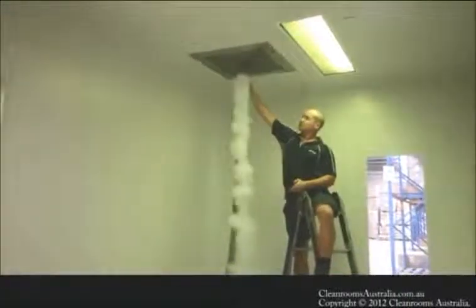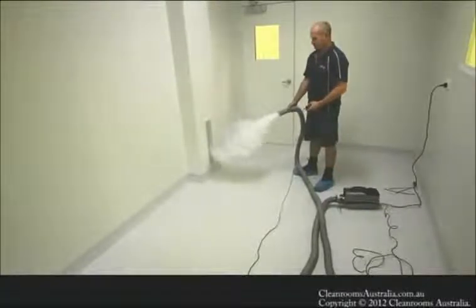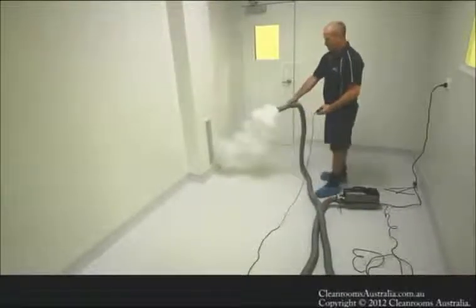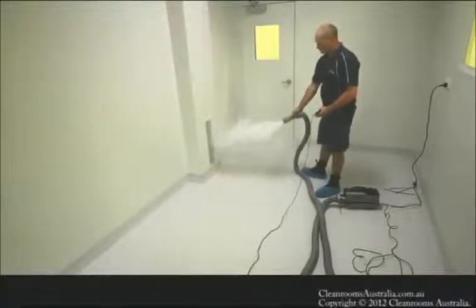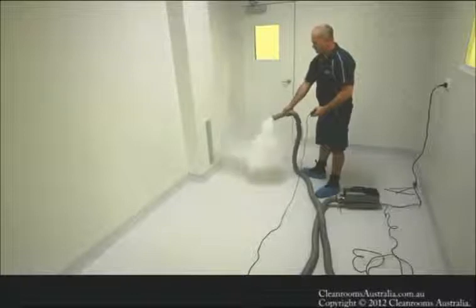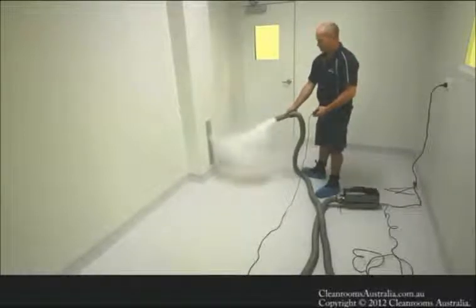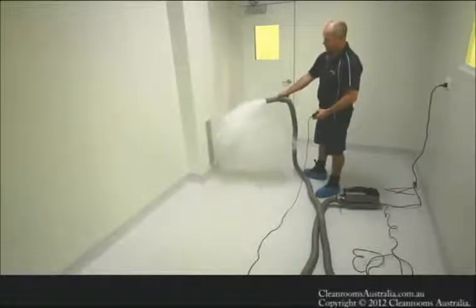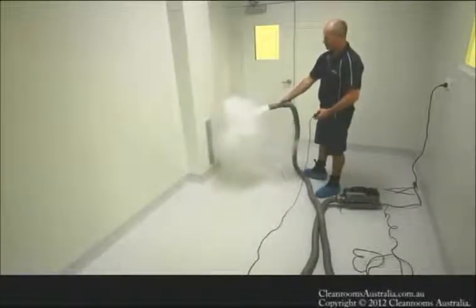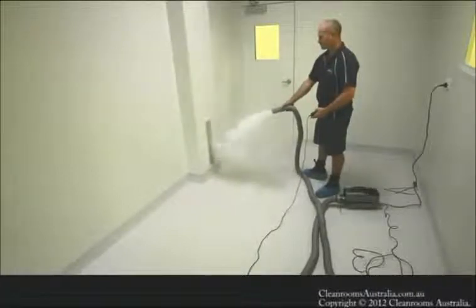You'll notice we've turned the lighting down to get some shadows on the walls, and we're using a nice crisp white smoke at high density. With all these things taken into consideration, you can get some very good visualizations of the mixing of the air, the laminar flow, and the mixed flow differential pressures across the boundaries.